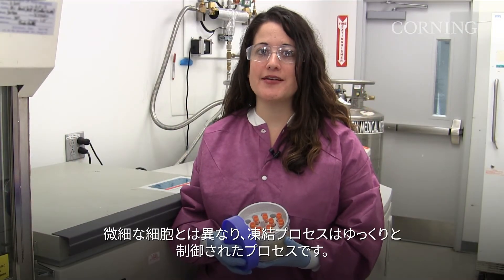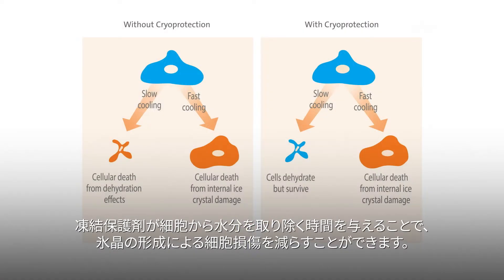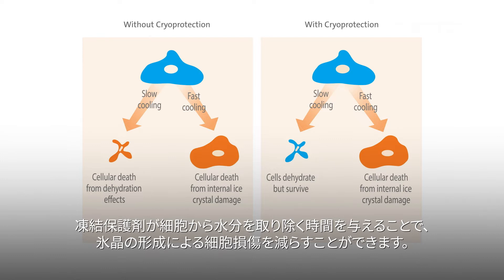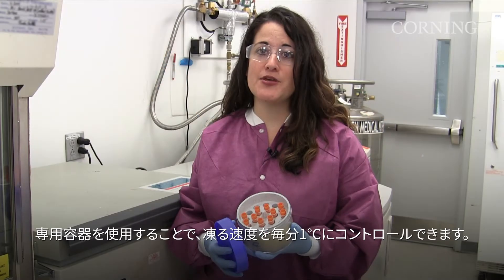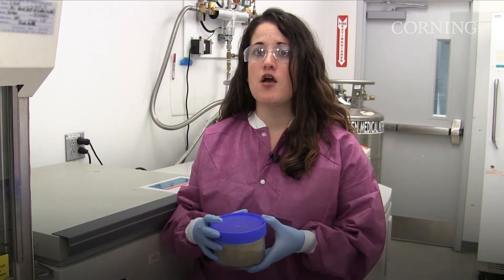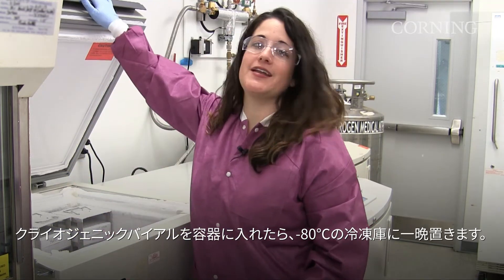Unlike thawing cells, the freezing process is a slow, controlled process. You want to give the cryoprotectant time to remove water from the cells, which reduces their chances of being damaged by the formation of ice crystals. I will be using a specialized container that controls the rate of freeze to 1 degree Celsius per minute. Once the cryogenic vials are in the container, they can be placed in a minus 80 freezer overnight.